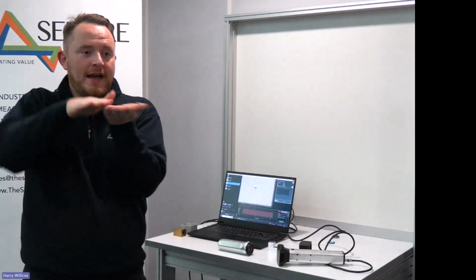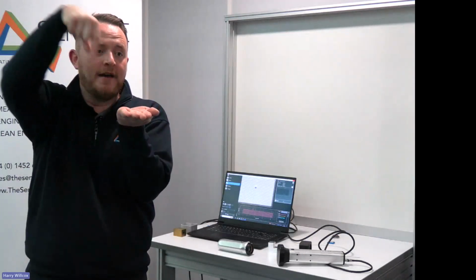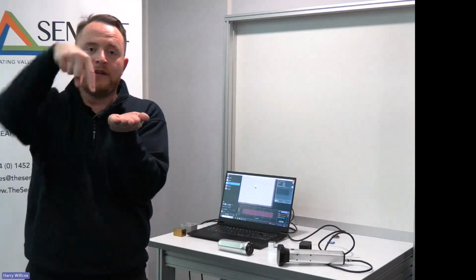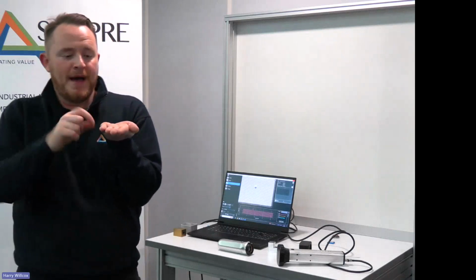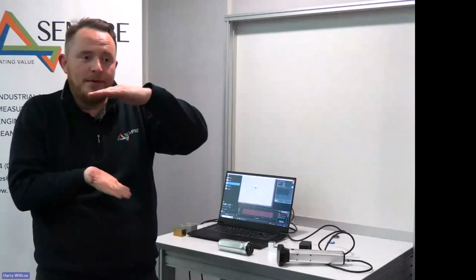Now, the limitation when you look at Z depth is effectively a simple equation that you work out. Imagine I had a surface like my hand and I prodded a hole into my hand with my finger, at the diameter of my finger. The width of the mark on my hand is about this wide and about this deep, and the pad is effectively going to roll into the bottom. So we won't see the bottom of the surface.